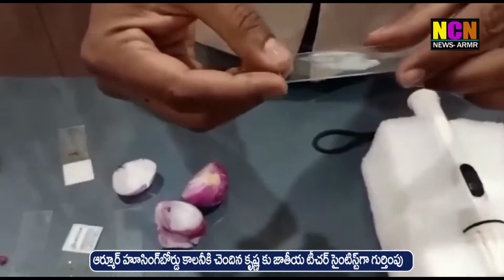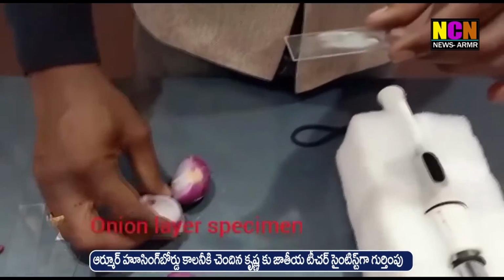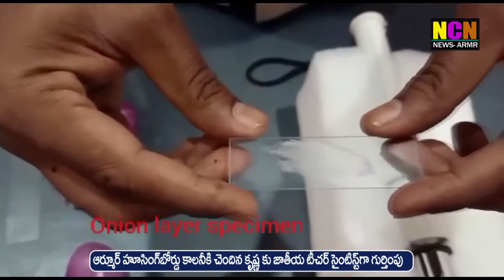To watch the specimen of an onion layer, we have to take a layer from an onion and place it on an empty slide.